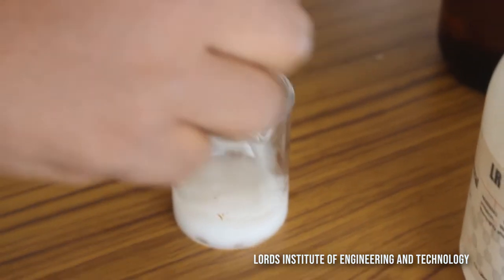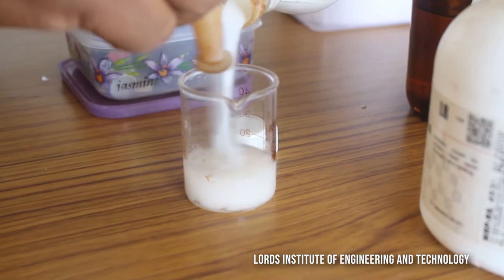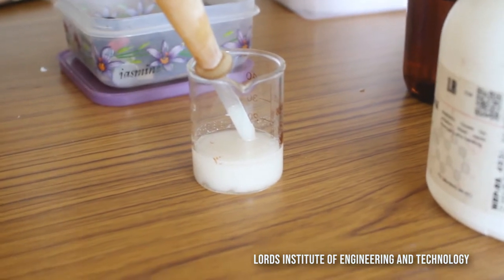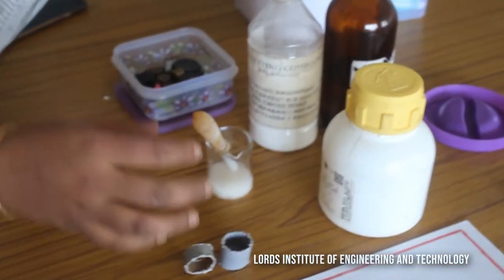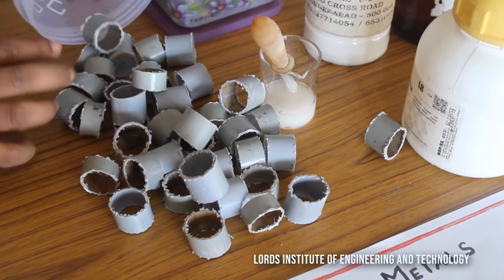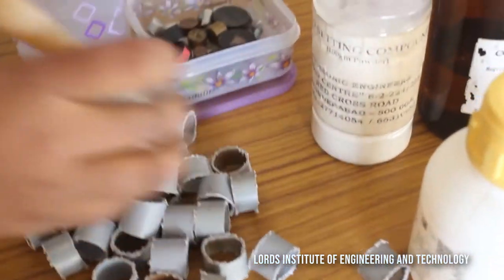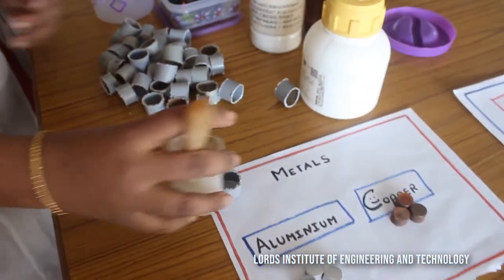After mixing is done, we are going to cut PVC pipes into the required shapes. If you observe, you will find a number of PVC pipes cut into different shapes — they need not be the same shape and size. After this we are going to pour this solid solution into the PVC pipe.